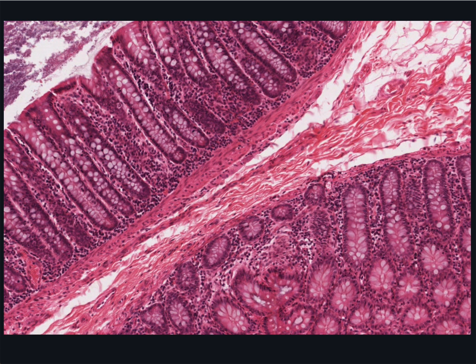The connective tissue of the lamina propria is heavily infiltrated by lymphocytes and plasma cells, and lymph nodules are scattered, often in the submucosa near the junction with the mucosa.